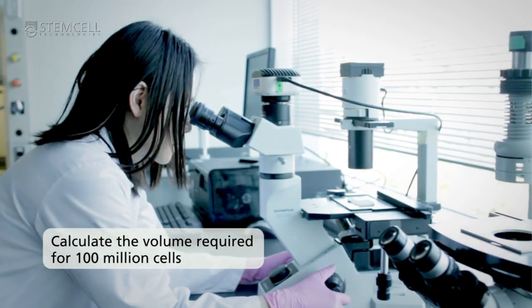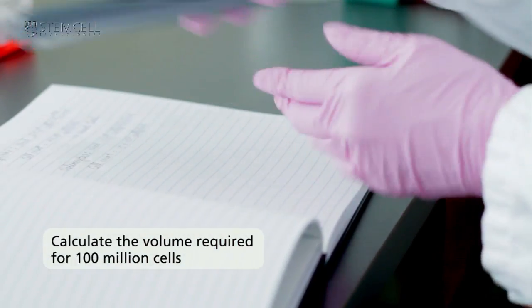Perform a nucleated cell count. Calculate the volume required for 100 million cells.